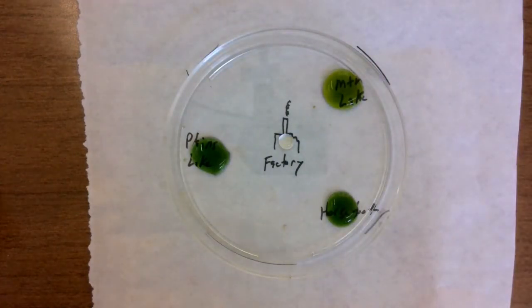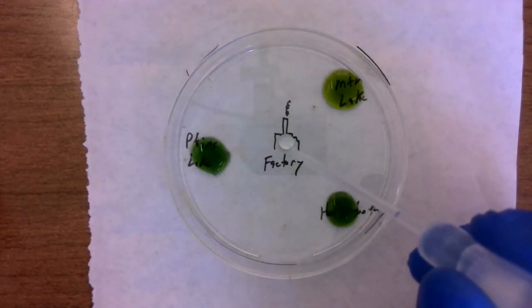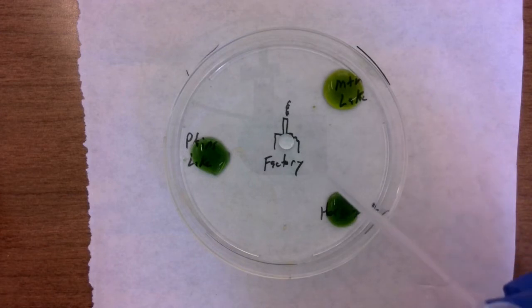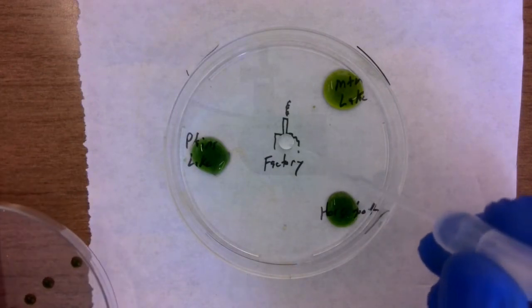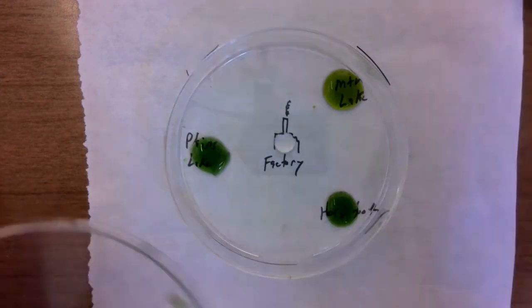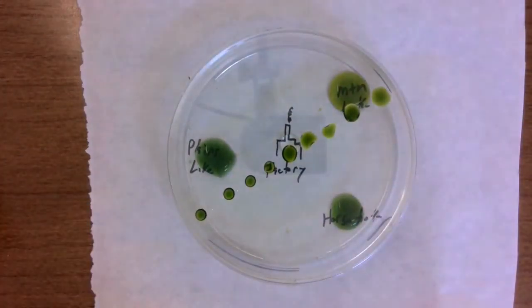And then I'm going to put in some nitrate compounds, some sodium nitrite, actually, which is NaNO2. And as soon as I put these together, I'm going to put the lid on, and then we need to watch what happens here. Okay, here we go. Lid's upside down, and let's make some observations.